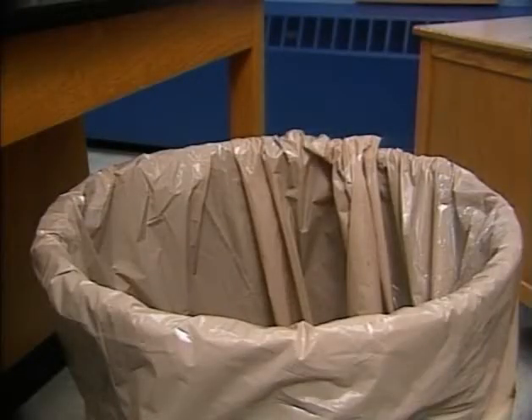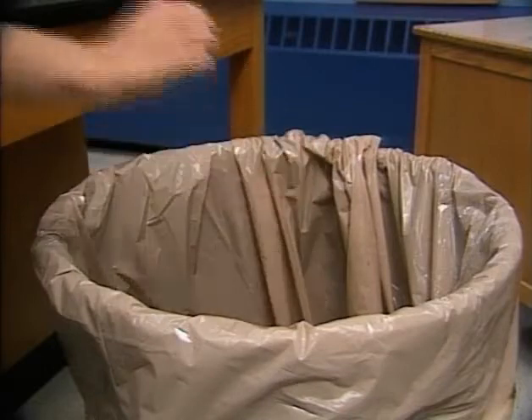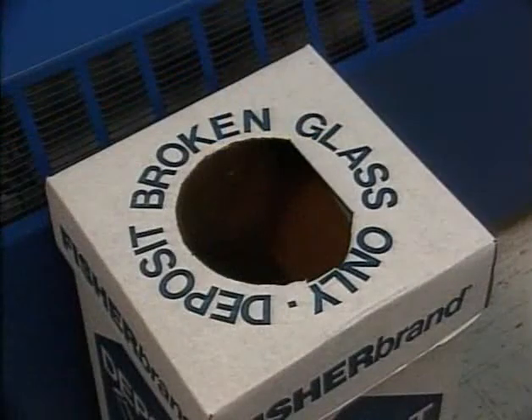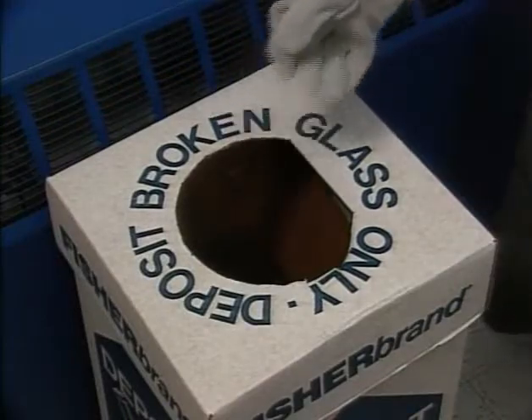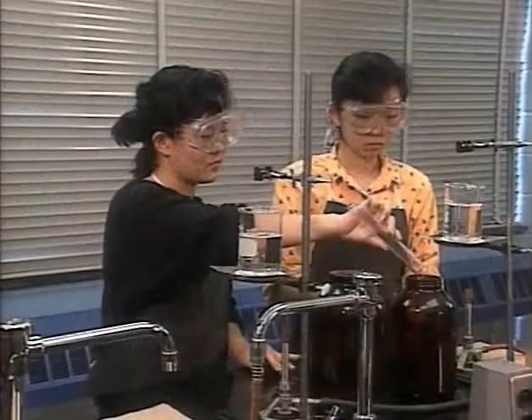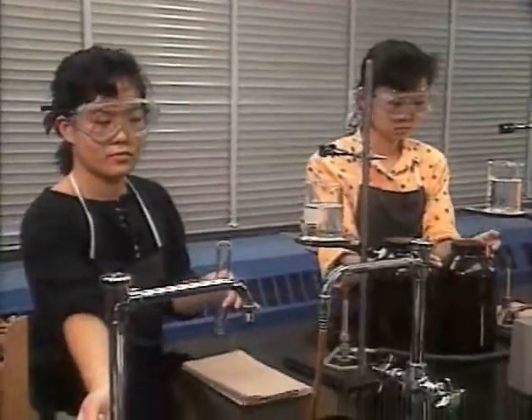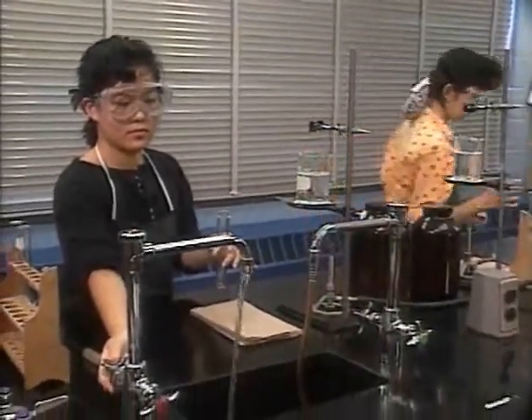Don't throw waste chemicals down the sink unless your teacher says it's all right. Waste paper that's not contaminated by chemicals goes in a conventional trash can, and broken glassware goes into a separate container.